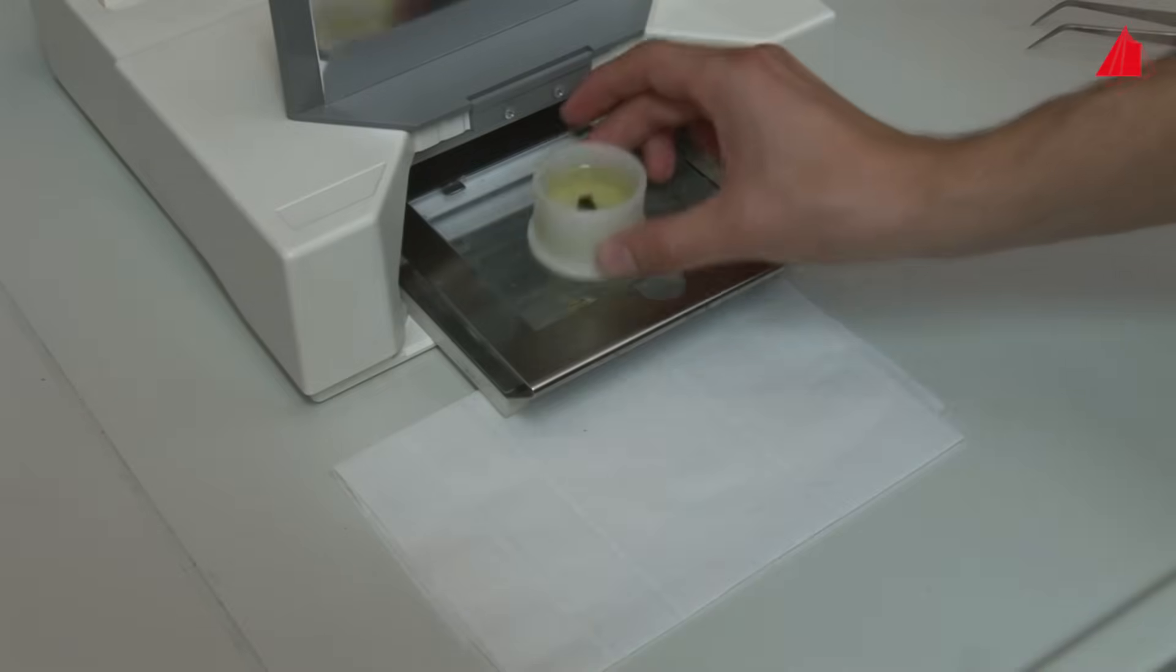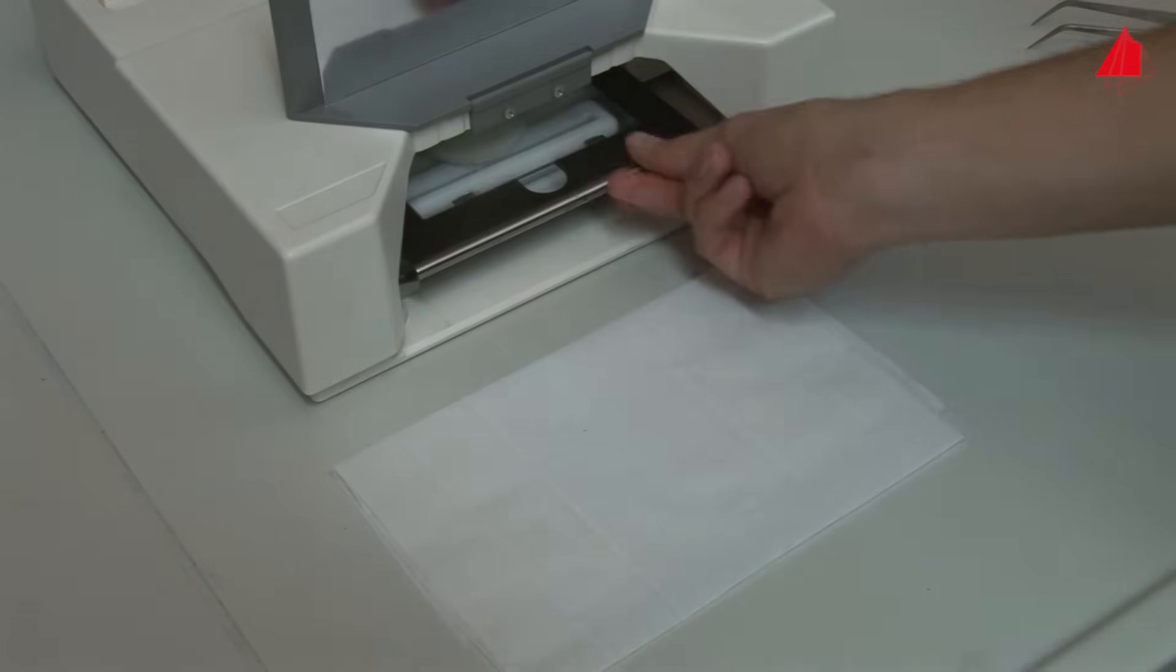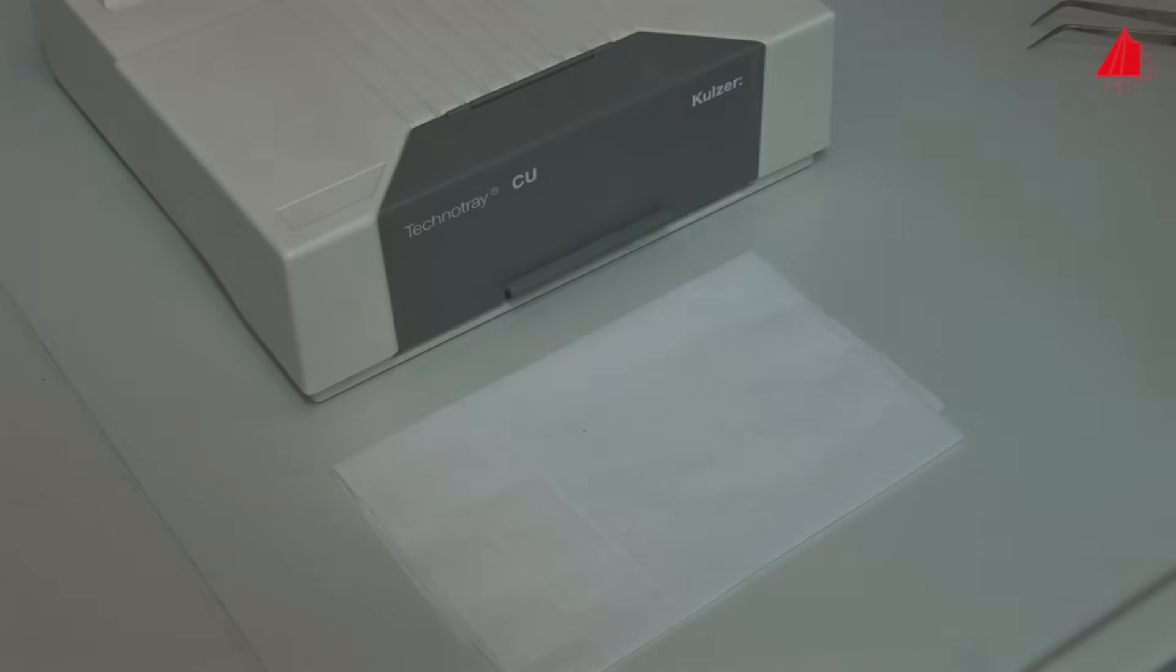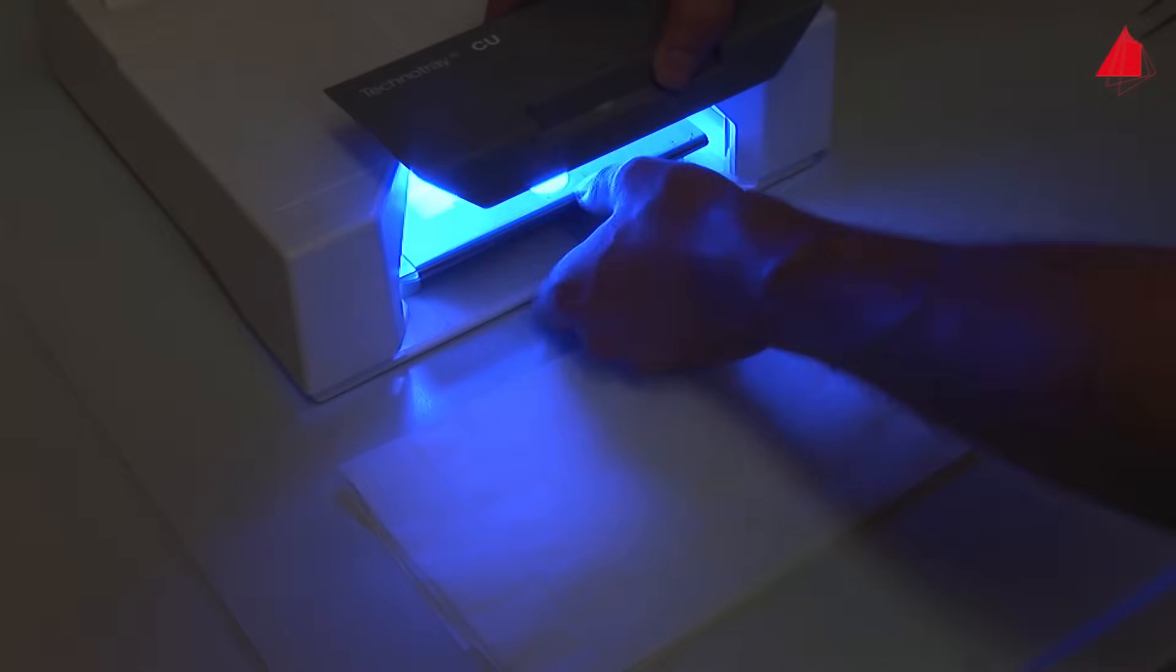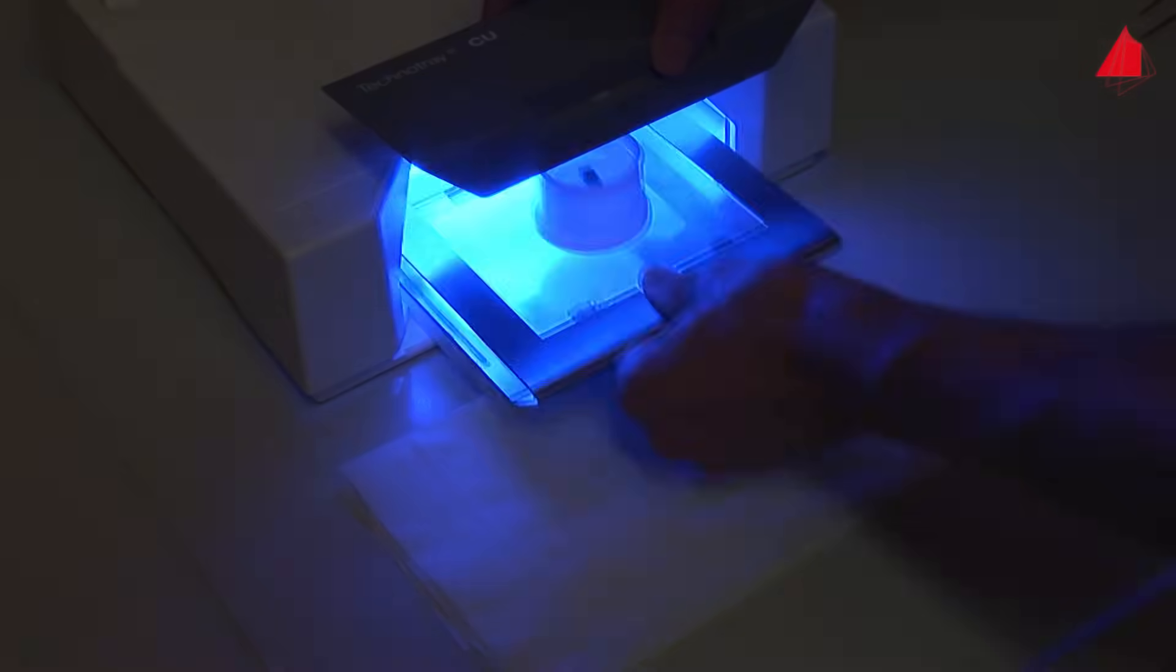Now the mould containing the specimen goes into the light-curing unit. Under the action of intense blue light, the resin polymerizes within half an hour. The resin has cured and embedded the specimen well.